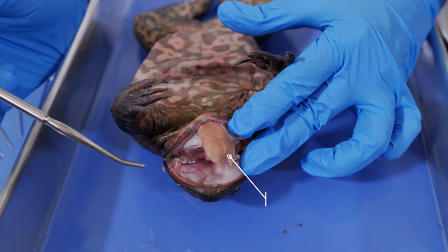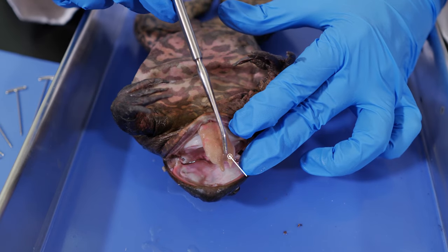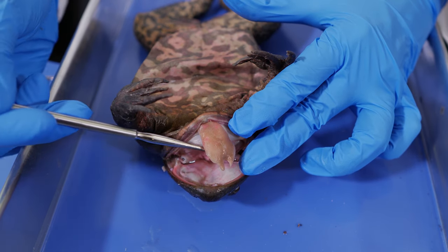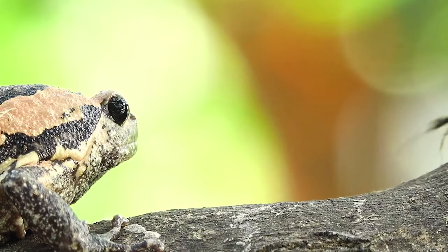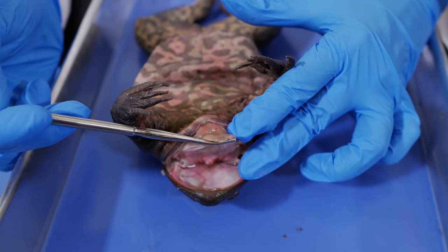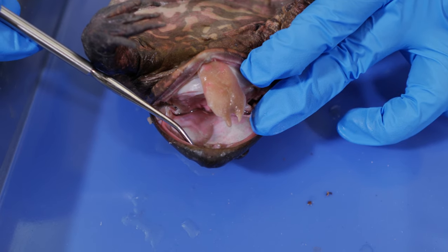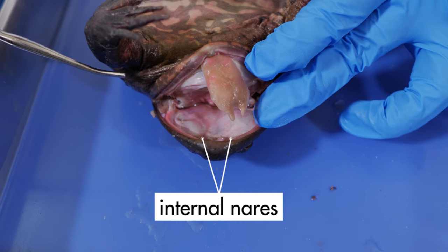Notice the tongue. A frog's tongue is split in the middle. A frog can stretch its tongue out quite far and quite rapidly — it can do this because the tongue is attached towards the front of the mouth. When we examined the external anatomy on the dorsal side of the frog, we saw the external nares. The nares open into the mouth cavity here and here; these are called the internal nares.